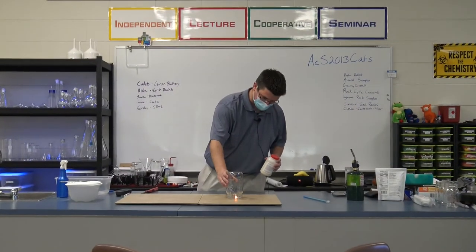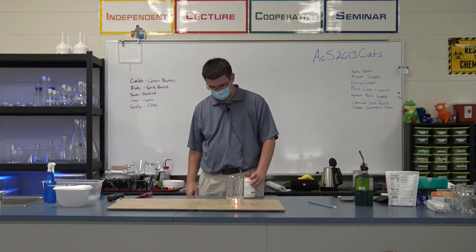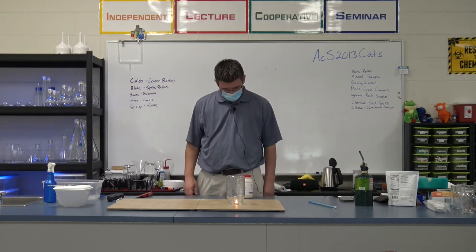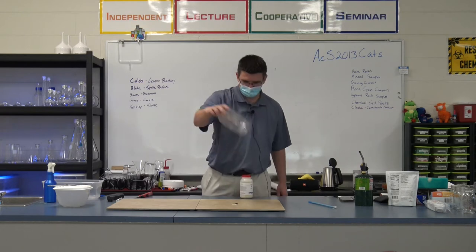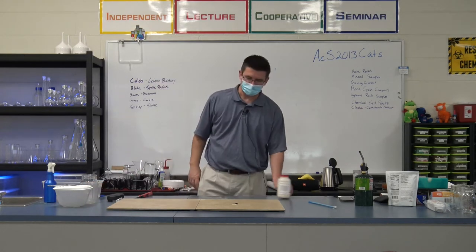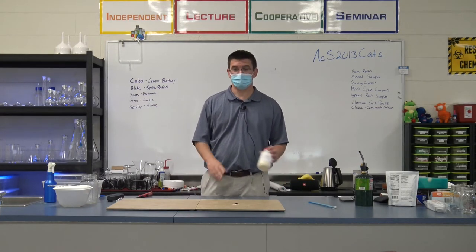I'm just going to cap a jar over that. That'll cut off its air, maybe. I don't know if it'll seal good enough to cut off its air or not, honestly. But we want it to burn out. I may need to just put something on it. There it goes. All right, so it used up all its oxygen in the jar, and our fire went out. Our dangerous, flammable, solid Lycopodium.